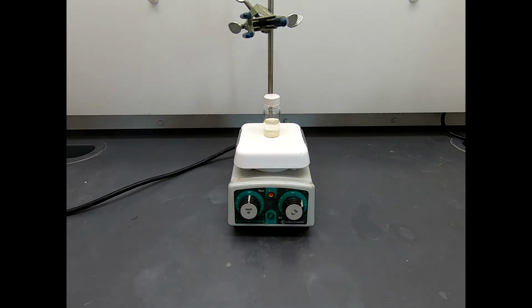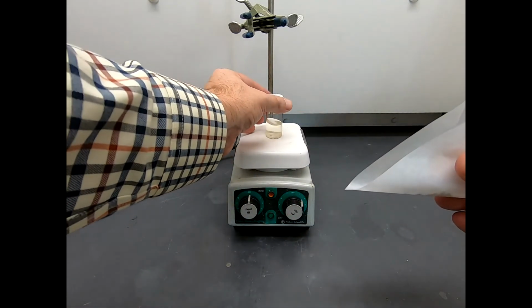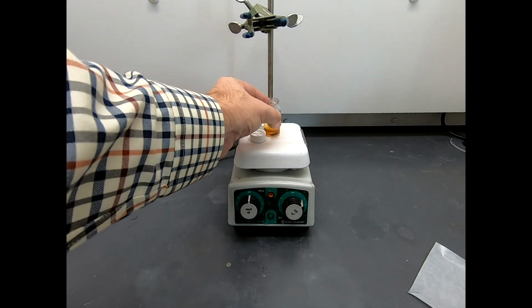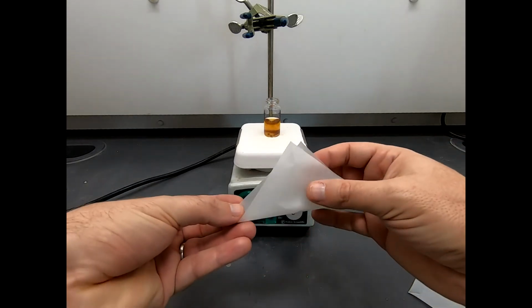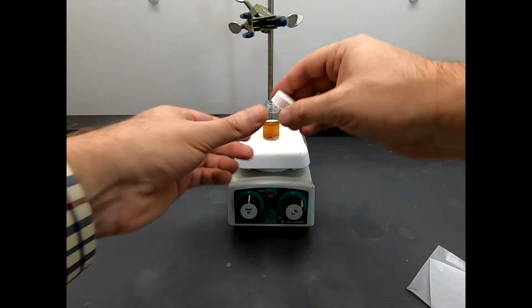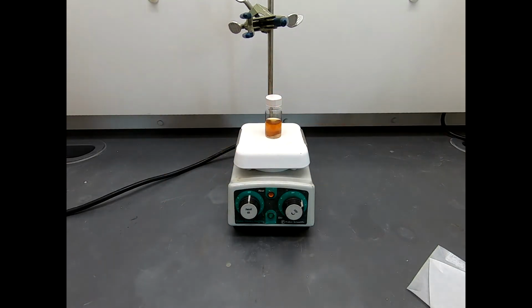So now we have to add our two other reagents. I'm going to go ahead and add the para-toluidine first. Slide that in there, nothing fancy. Let that stir. And then I'm going to add our sodium bicarbonate. Right there. That is a true dump and stir. And I will engage these threads, but I'm not going to screw them on tightly.